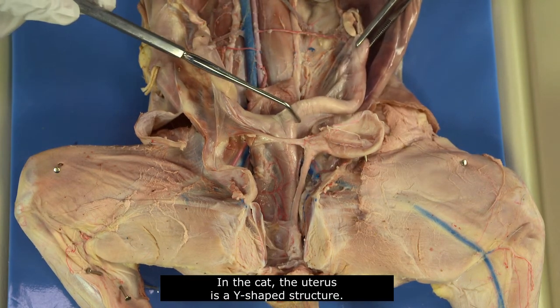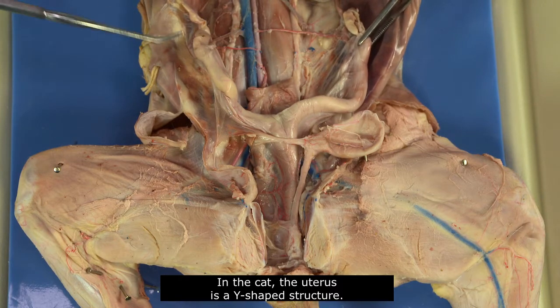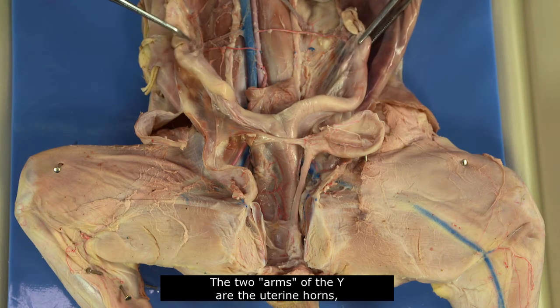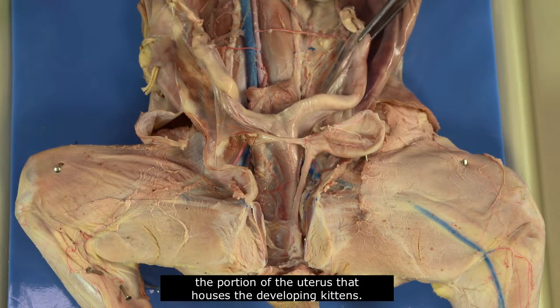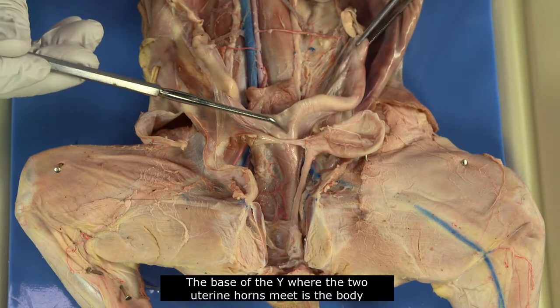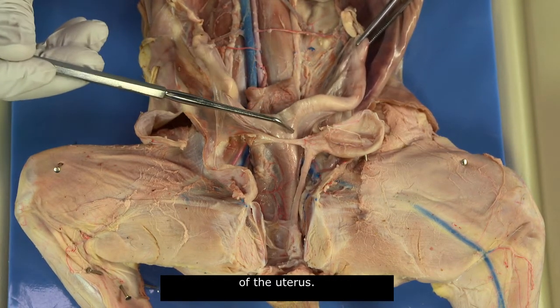In the cat, the uterus is a Y-shaped structure. The two arms of the Y are the uterine horns, the portion of the uterus that houses the developing kittens. The base of the Y, where the two uterine horns meet, is the body of the uterus.